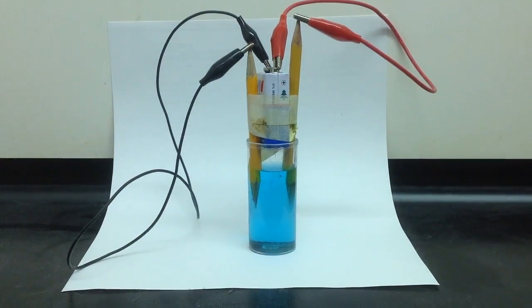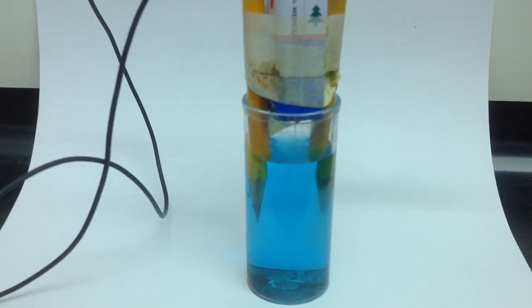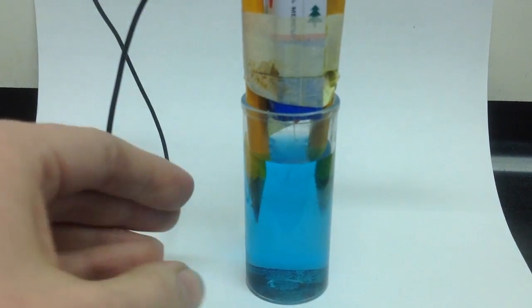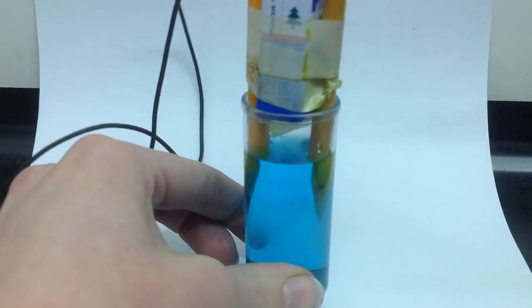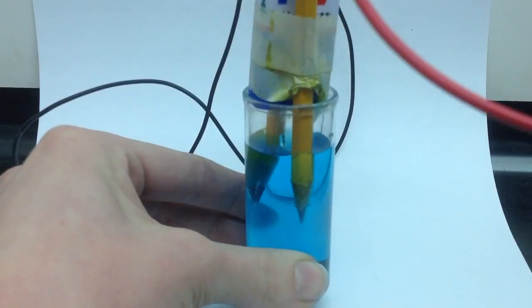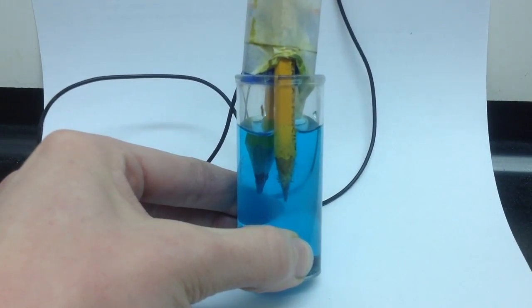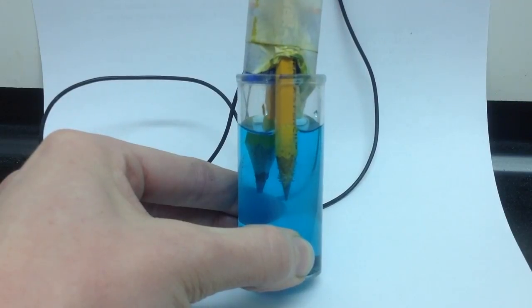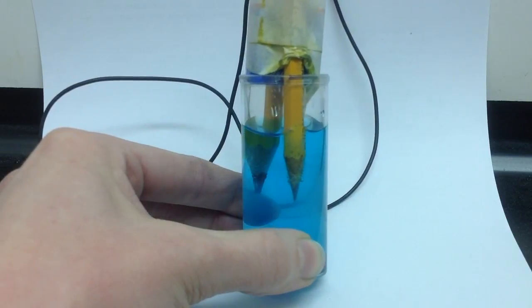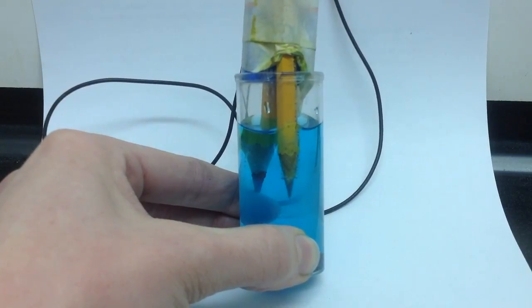So, my reaction is taking place. So, I must have some good connection somewhere. If I zoom in here, let's start with this electrode. You can kind of see that it's forming bubbles. We kind of have some fizzing that's moving up. Some very, very small bubbles that are accumulating into bigger bubbles on the tip of that pencil.